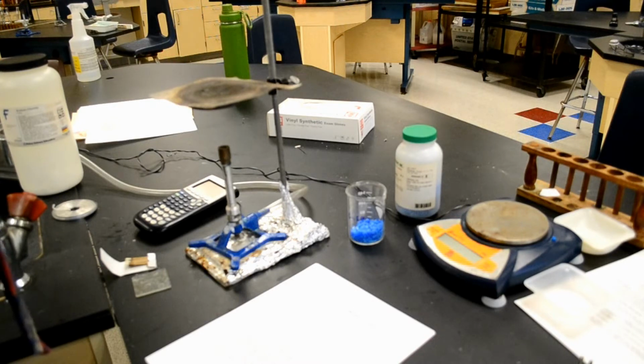The percentage of water can be calculated by using this formula. Percent of water is equal to the mass of the water divided by the mass of the hydrate times 100. In this experiment, a hydrate of copper sulfate will be studied. Note that the X indicates the unknown number of moles of water that you will have to determine in this lab. When a hydrate of copper sulfate is heated, the anhydrous form of copper sulfate is produced.